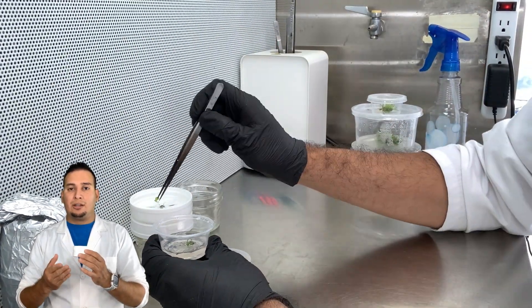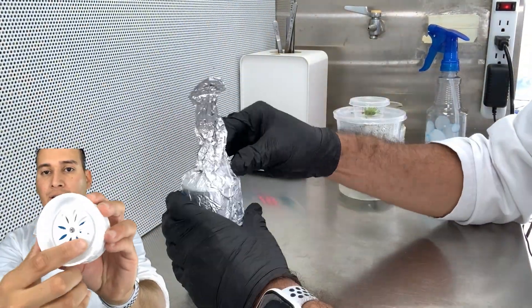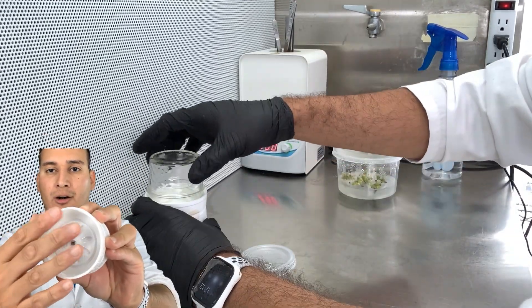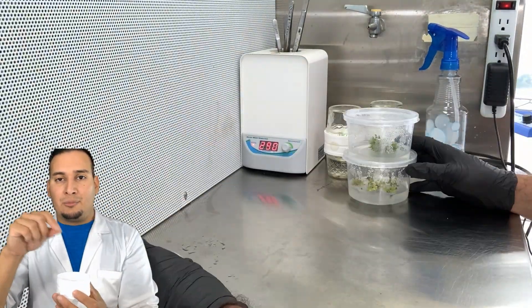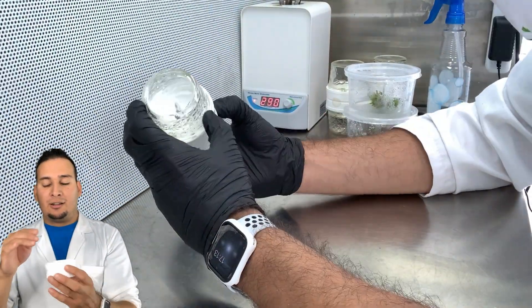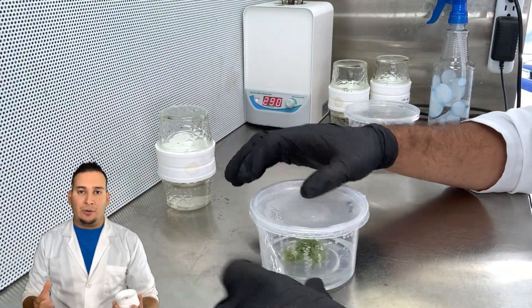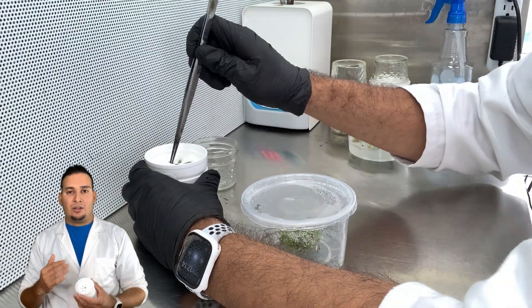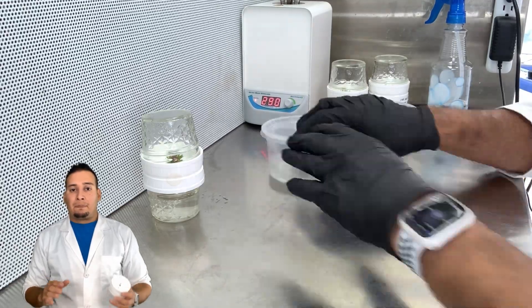While doing experiments I pretty much figured out that you have one side up and one side down — where you have the screw is basically where the coupler adjusts. You want to use this side up. It doesn't really matter if you use the other side, but whenever you're moving the plants, if you have to adjust the bend, it is much easier to use this side as up. That's the only thing; there's not really a rule about which way is up or down.